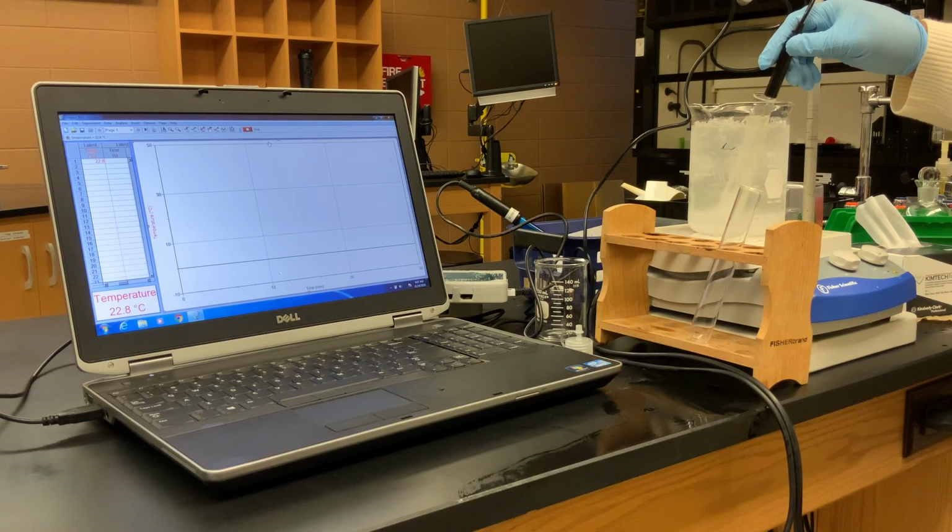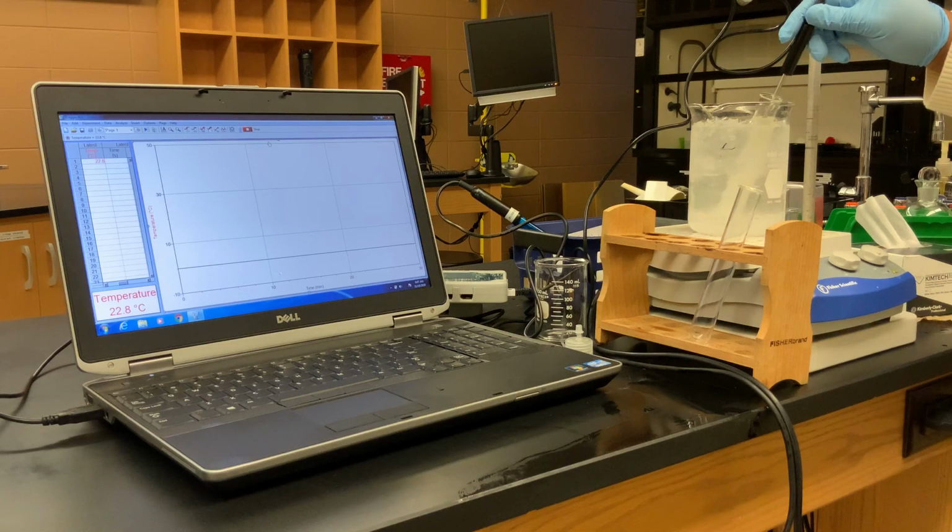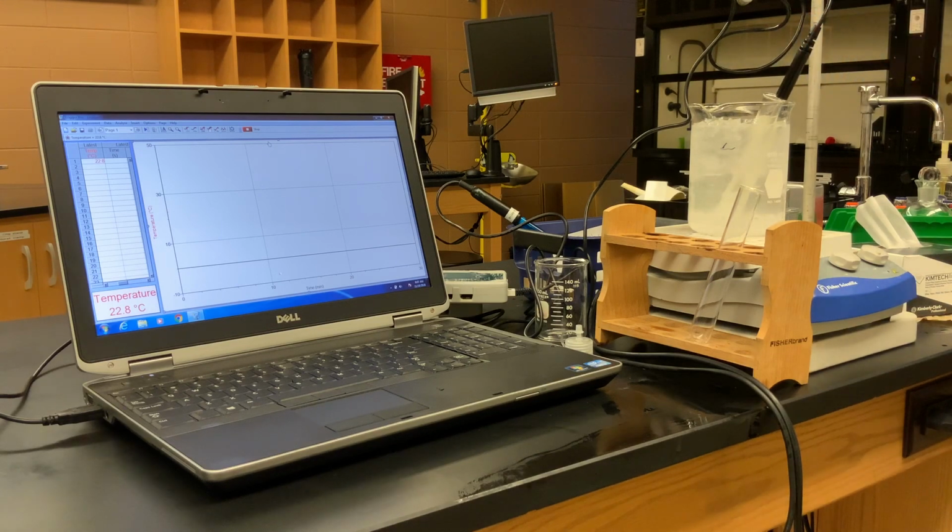So at each temperature reading, and we're going to get one reading each minute, we not only want to note the temperature and the time, but we also want to note whether or not our diesel is in a solid state or a liquid state. So of course we're starting off in the liquid state, and we want to therefore stop collecting data when our biodiesel has frozen. It's in a total solid state.